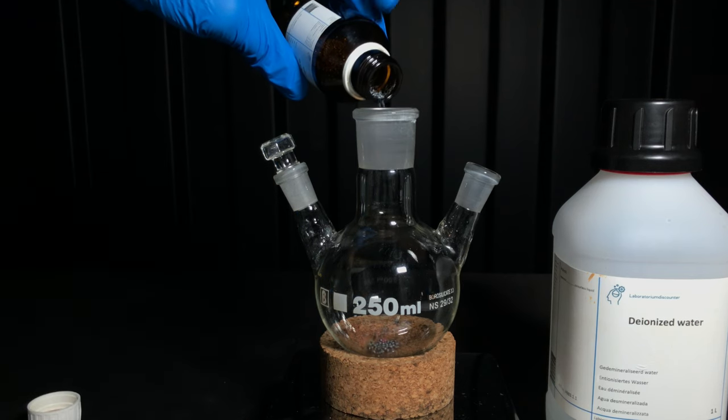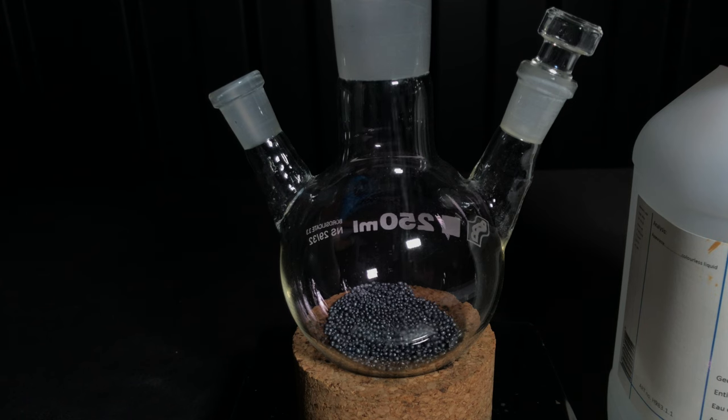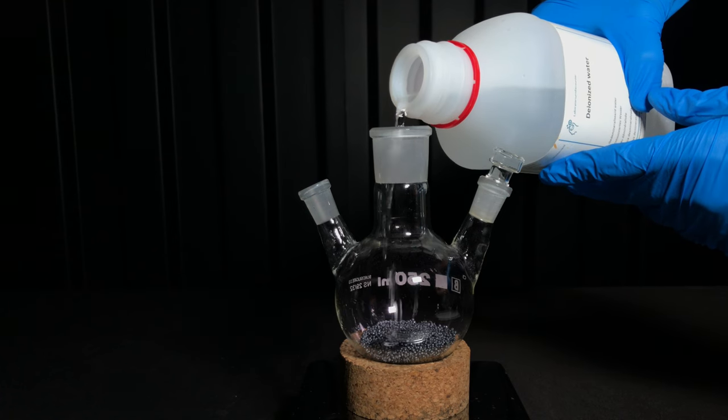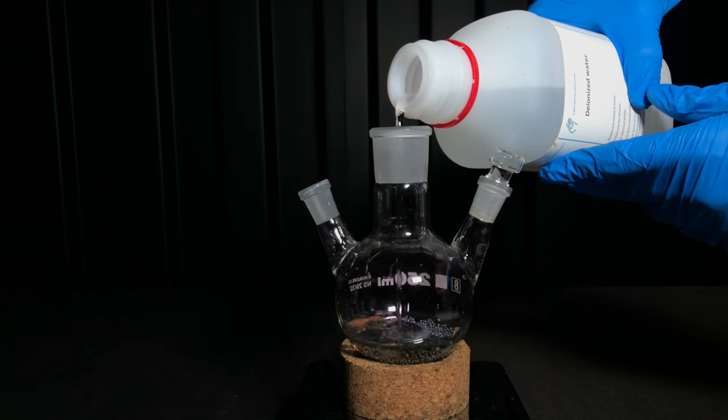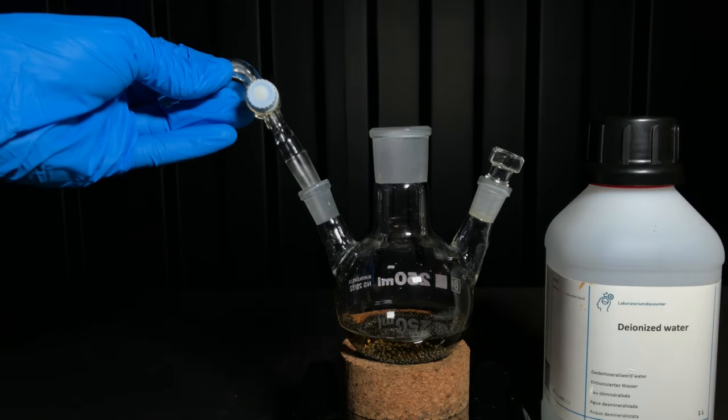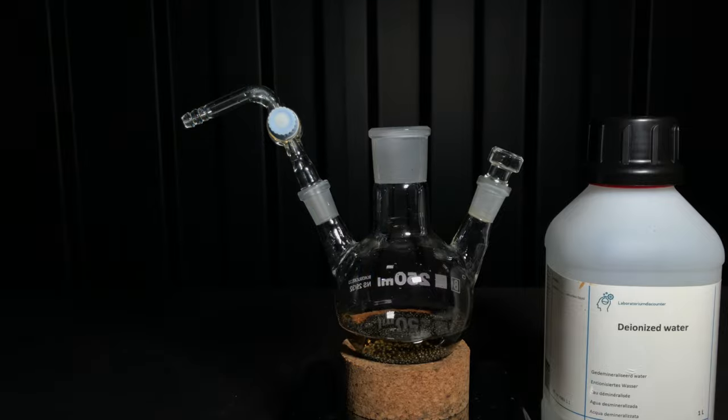If you look really closely you can actually see a faint purple color because of iodine vapor. The reaction of iodine with hydrazine hydrate directly is extremely violent. To make it calmer and also not to lose our intermediate product, which I will talk about later, distilled water was added.